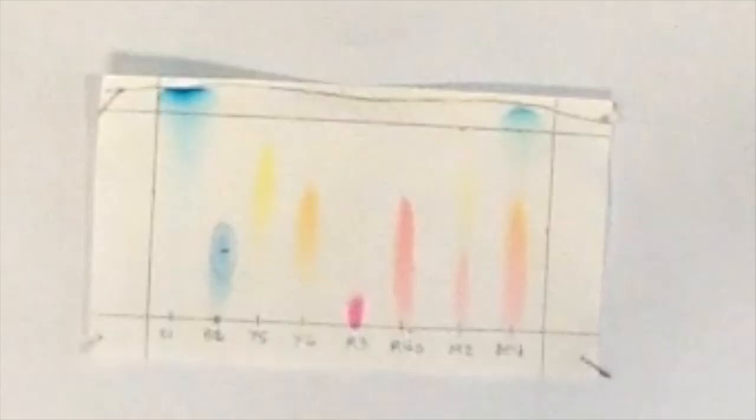Next you will measure the RF value of each mixture. For example, let's measure the B2 mixture. To measure RF, you will make an oval around the mixture of where it traveled. Place a dot in the middle of the oval you drew.